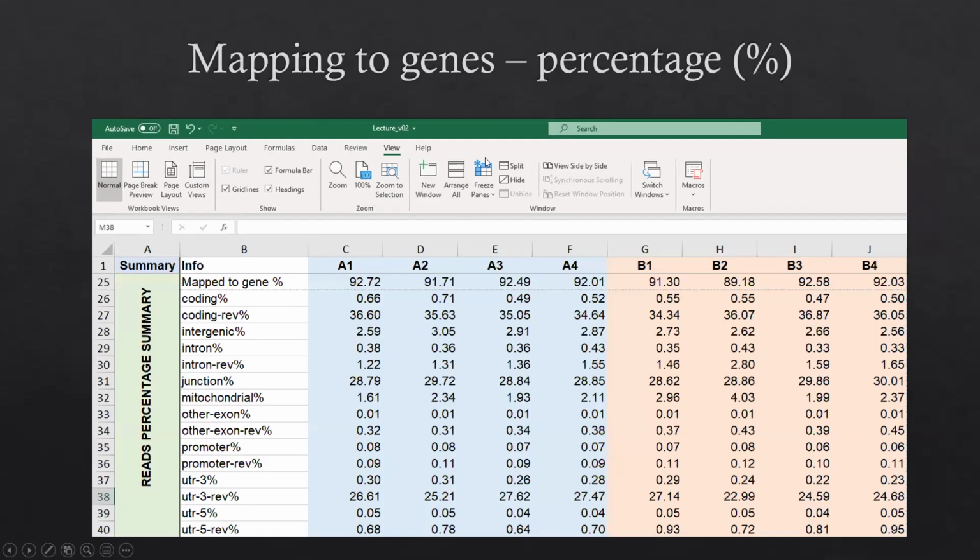This is a file in terms of the percentage rather than the total number of reads. So you can easily see the quality of the sequence in terms of how many reads map to the genes. Here we have 8 samples, exactly the same as we showed in the previous slides. Over 90% of reads can be mapped to genes. That's really good. There is also further information you can find from this file.